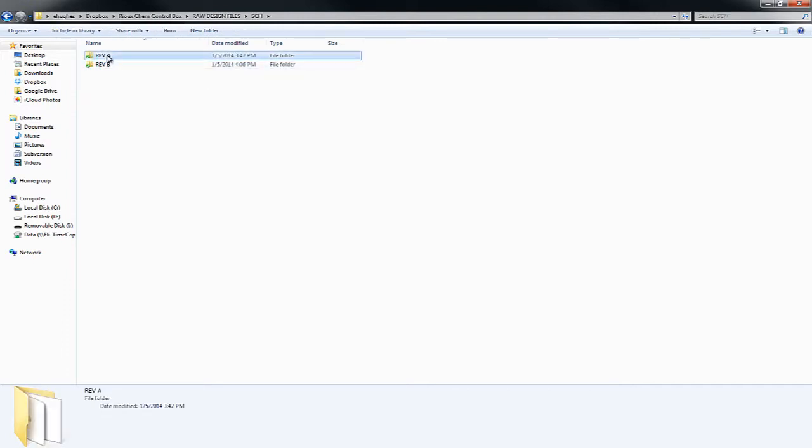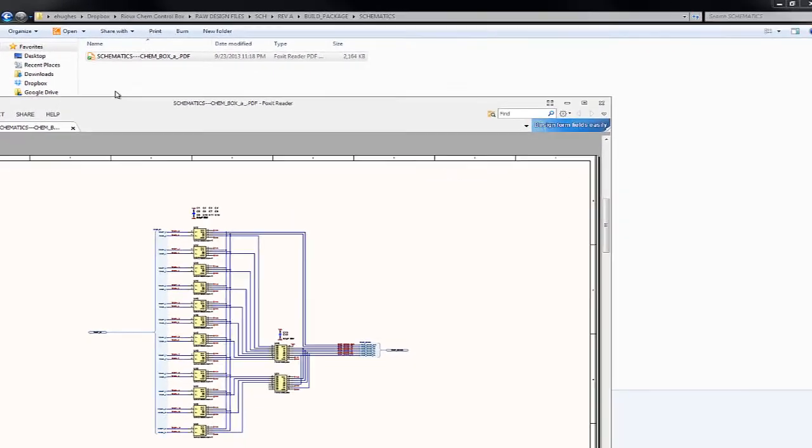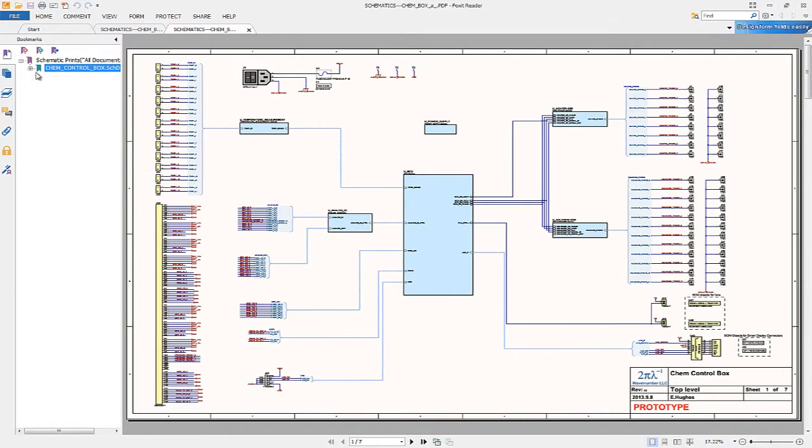So under Rev A, it doesn't really matter. Under schematics, you can go in here, open up a PDF file, and take a look at it. Now, what I'm going to do to make things easier for me is bring over Altium Designer, and I'm going to pan around the schematics because it's a little bit easier to pan around in, and go through the different elements of the schematic.